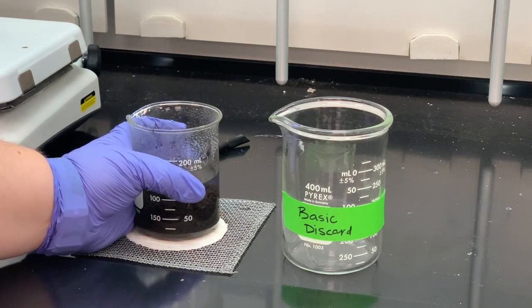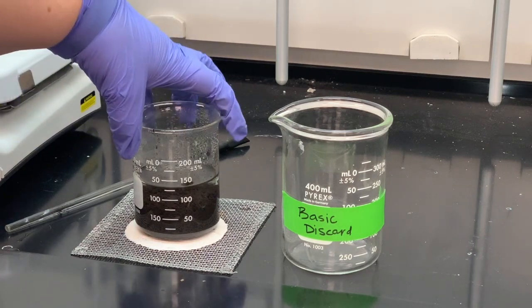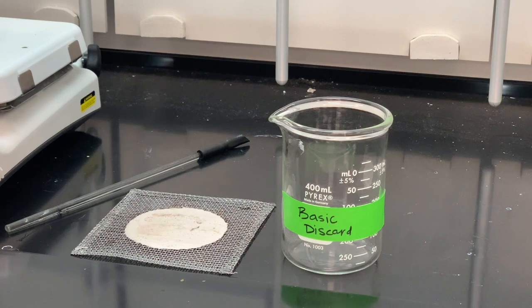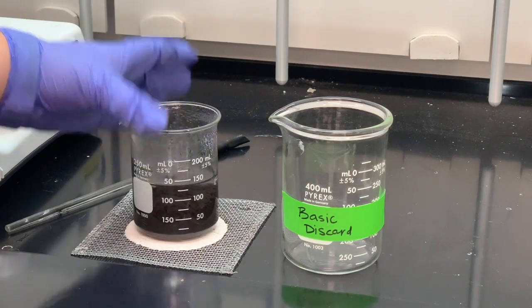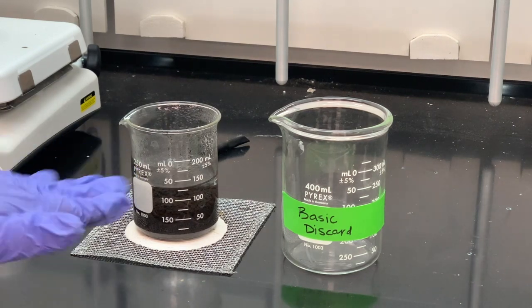Our solution has cooled off now. I can touch it with my hands without burning myself. This is about as good a separation as we're going to get. It's not going to fall completely down to the bottom of the solution and make it very easy for us to decant, but it's separated enough that we can decant most of that liquid off into a waste container.